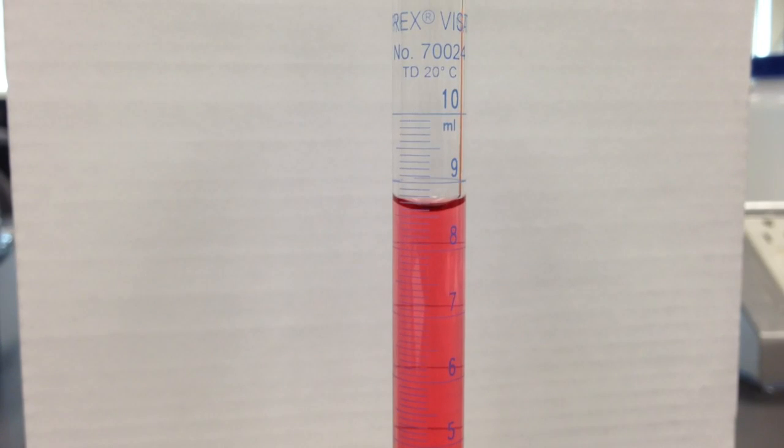How to read a graduated cylinder. We've got a 10 milliliter graduated cylinder here, and the first step we need to do is determine where our marks lie.